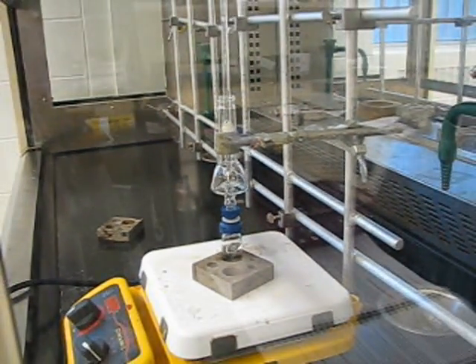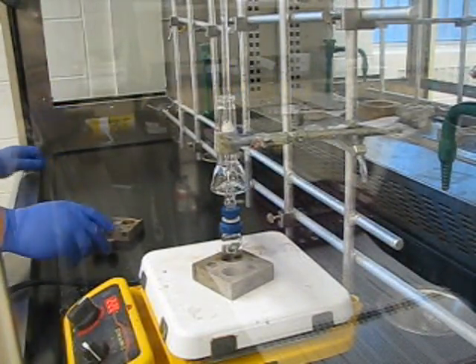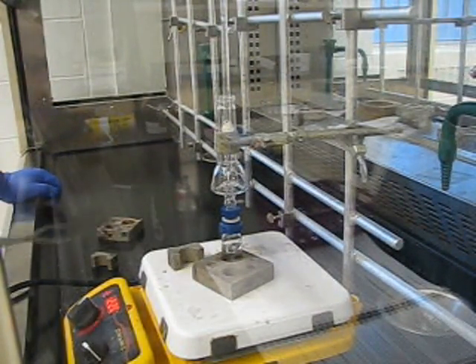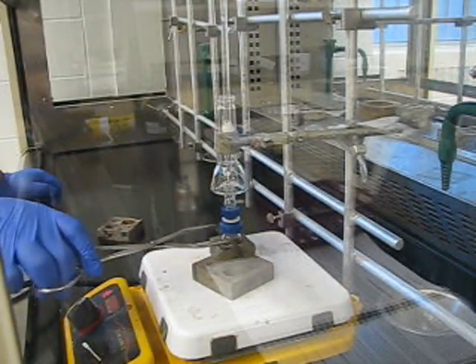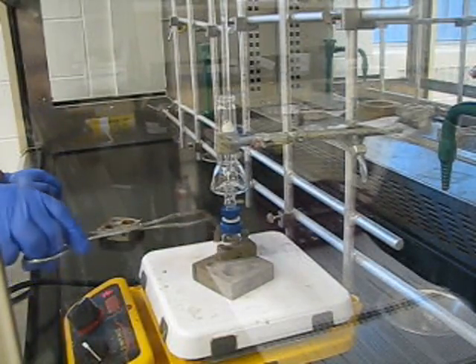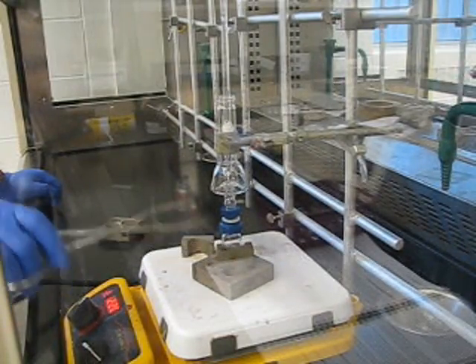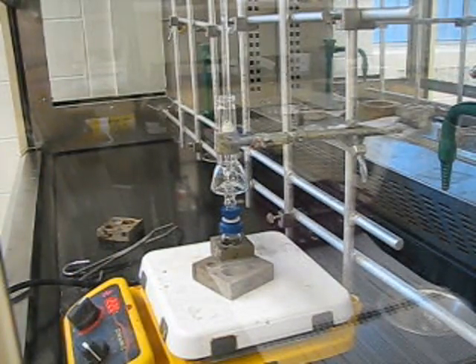After you get this set up, you can start heating, keeping the stirring going. Remember that the number on the hot plate does not tell you the temperature you're trying to heat to, so you'll probably need to go to 150, 200, or something like that to start. In your fume hood you also have these little half-blocks of aluminum — heating blocks. Using the tongs in the drawer underneath the hood, you can easily add and remove these to either slow down cooling, increase cooling, increase heating, or just to take a look at how much solvent is left.